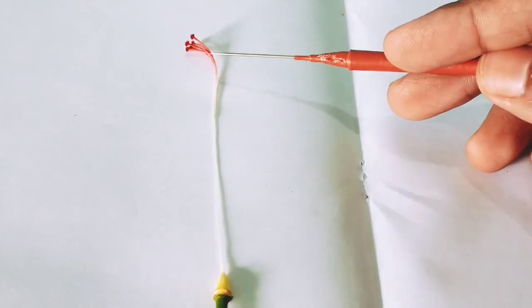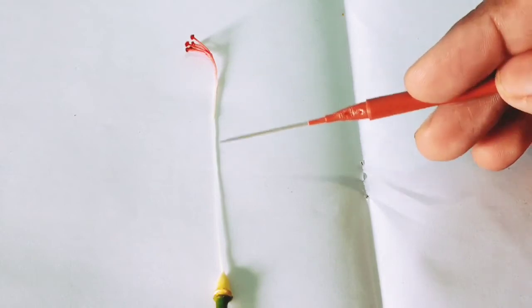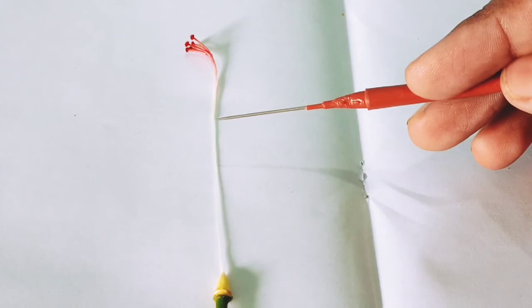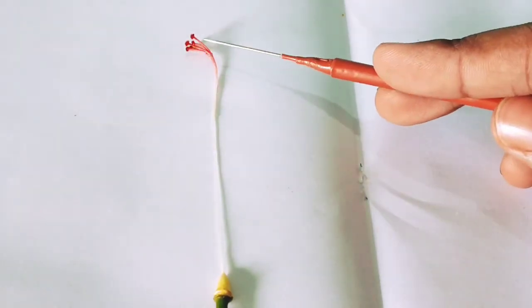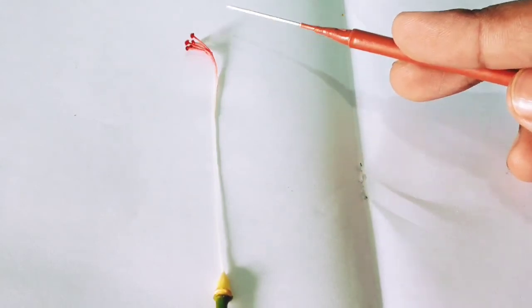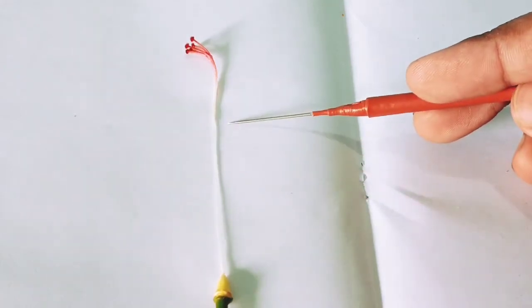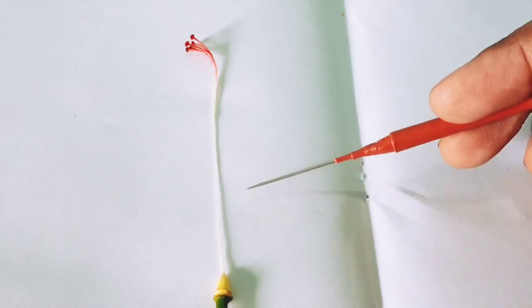Because the carpels are fused, and the ovary is superior and 5 chambered. Stigmas are 5 in number, and free. The style is simple, thin and long.